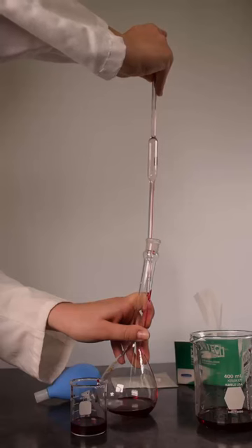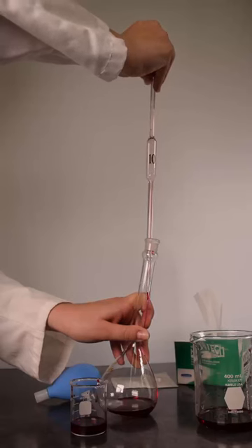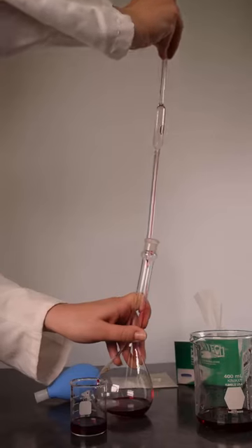After you've practiced your pipette skills, you can take aliquots directly from a volumetric flask instead of a beaker. You now know how to properly deliver an aliquot to either an Erlenmeyer or volumetric flask.